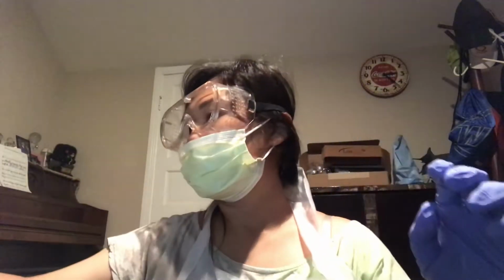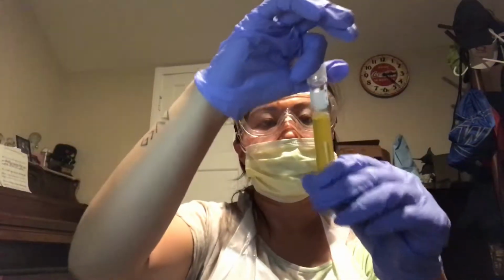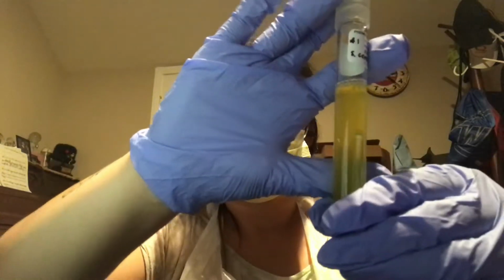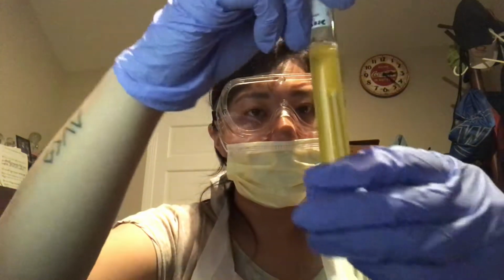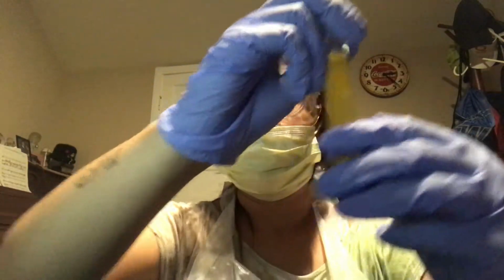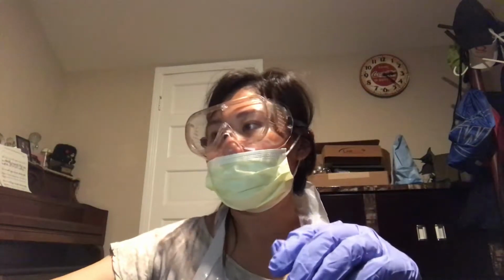So I'm going to go ahead and start with my test tube number 1 for S. cerevisiae with glucose. For this one, the color of the broth changed to yellow, and there's definitely presence of bubbles. There's some bubbles on the surface as well, and there are bubbles around inside the Durham tube. So this one is a fermenter with acid and gas production.